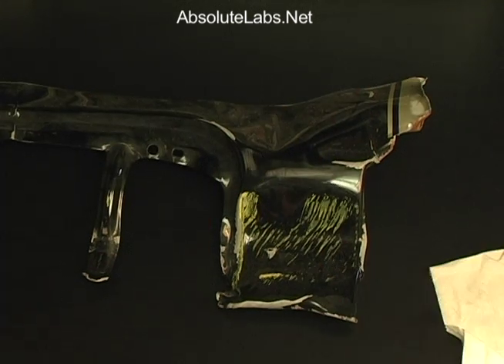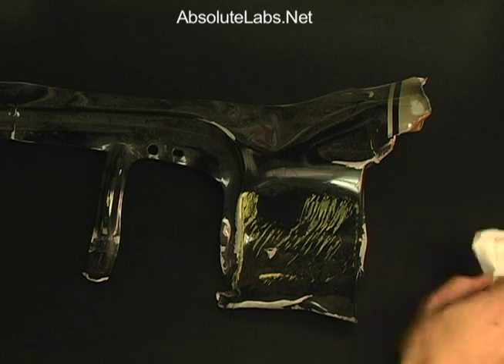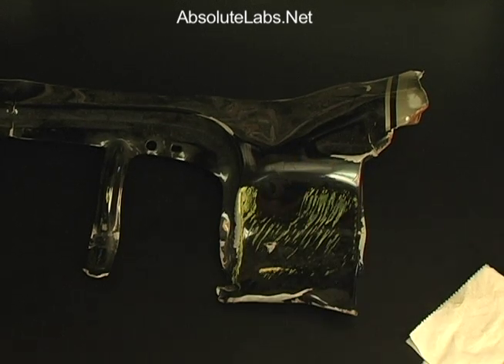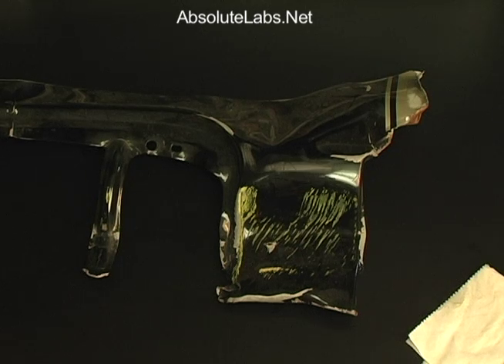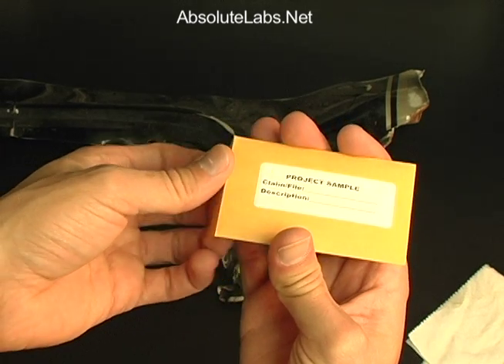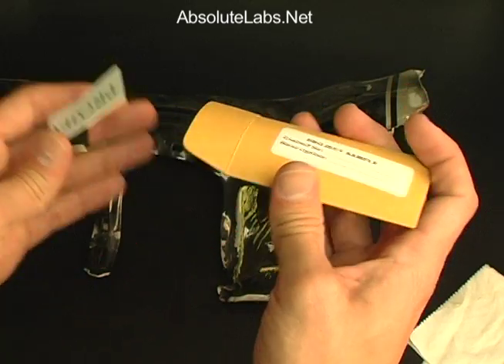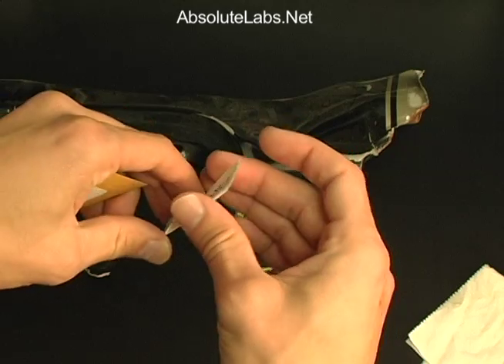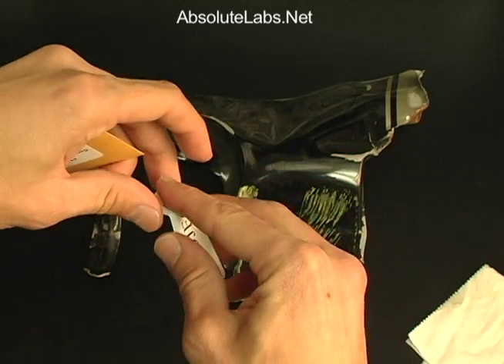Sampling the project area: if dirt or debris is present, wipe it gently with a clean cloth or tissue. Next, obtain the abrasive sampler from the project envelope. Handling it carefully by the edges, open the project abrasive sampler to expose the abrasive surface.